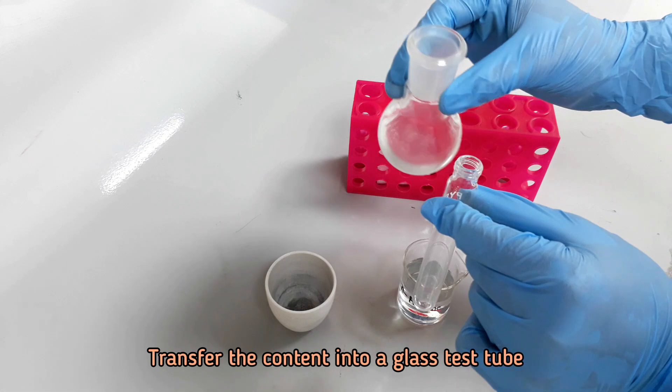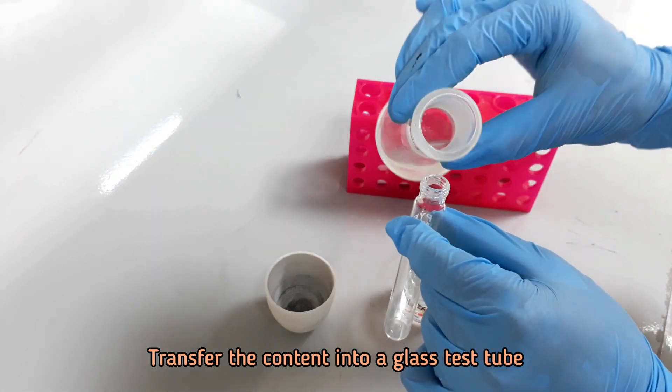Transfer the content into a clean glass test tube in which the upper layer of hexane will be separated perfectly.